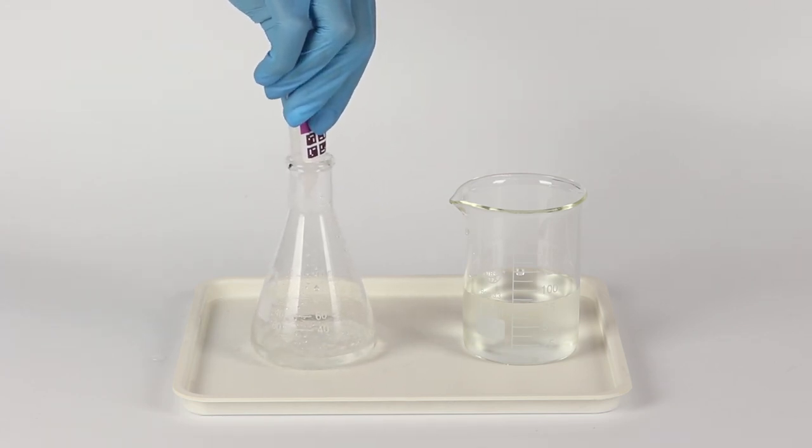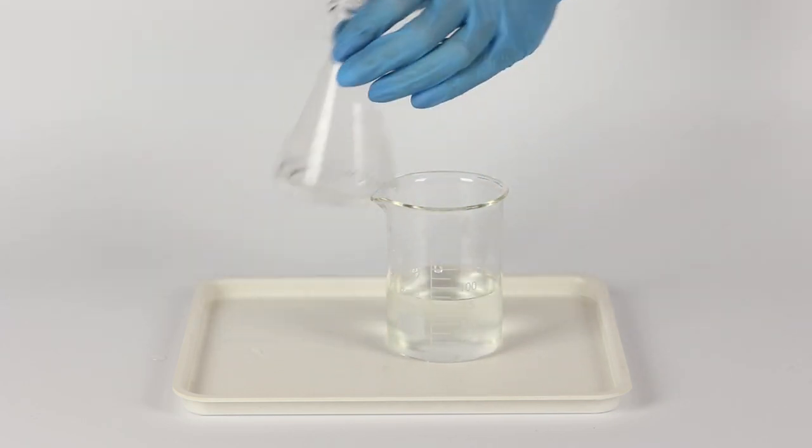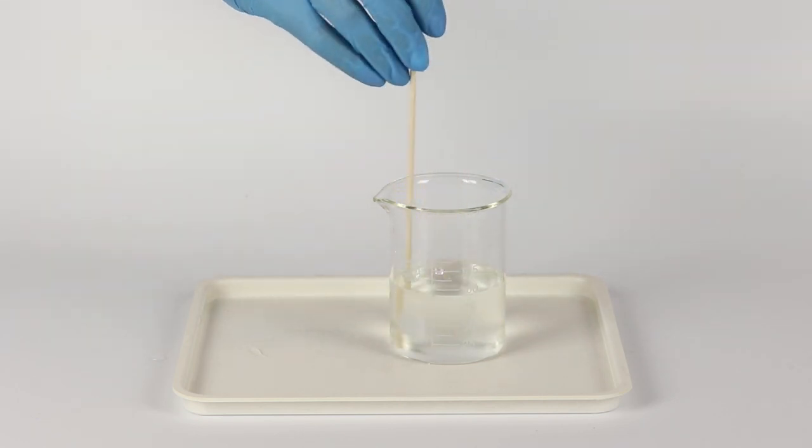Both of the solutions are colorless. Mix them. Take a wooden stick. Quickly pour the solution from the flask into the beaker. Mix the solution with the wooden stick and watch closely.